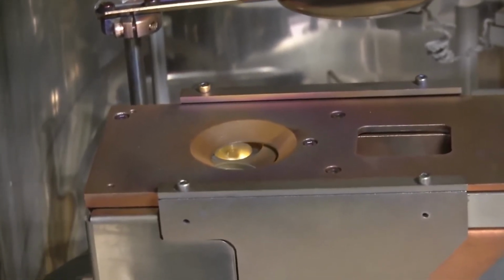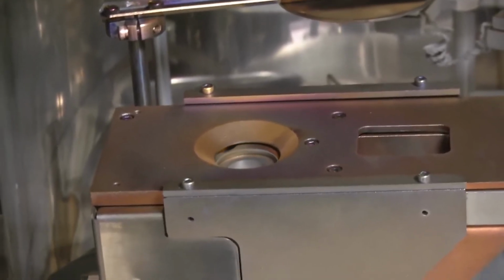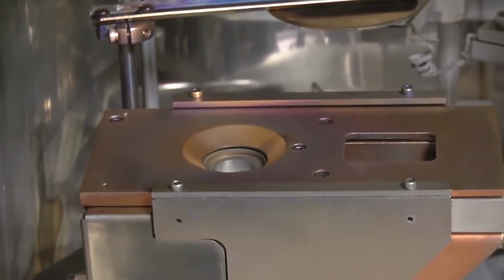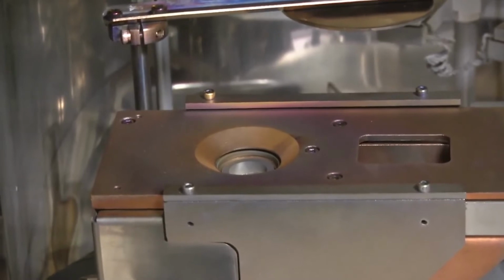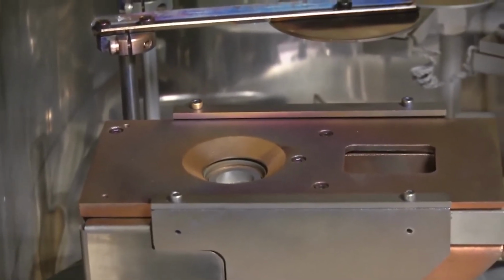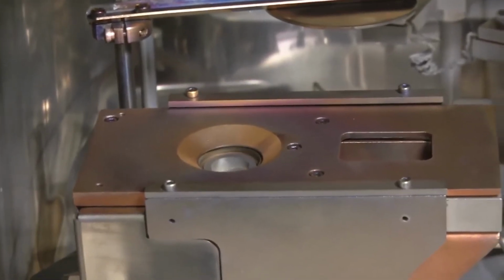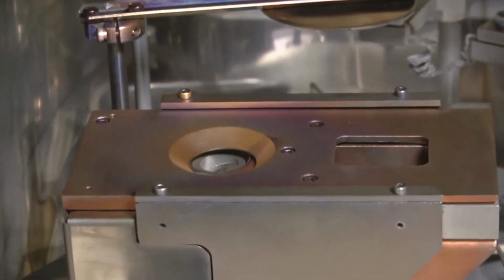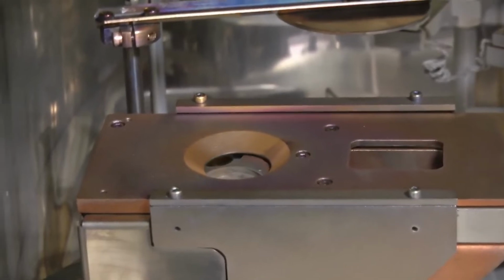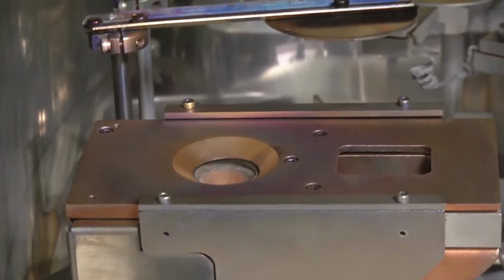For example, gold does not have very good adhesion on most substrates, and that's why chromium or titanium are used as adhesion layers. So in order to deposit gold, one has to first deposit titanium or chromium and then gold without breaking the vacuum. So this is another advantage of using multiple crucibles which can hold multiple metals. But one important caveat here is that each metal will have its own melting point, and therefore the currents have to be optimized for each type of metal to be deposited.